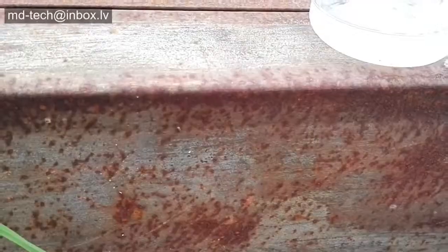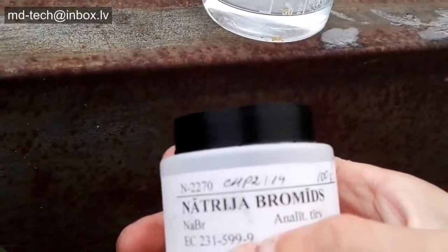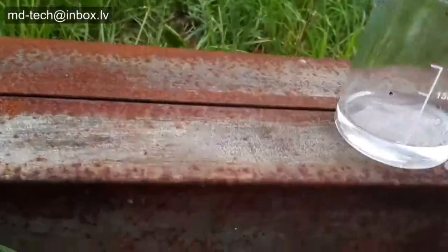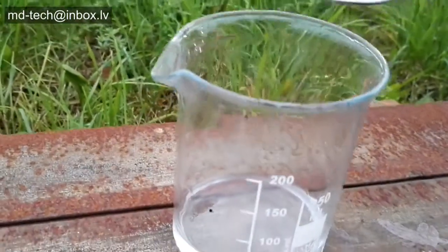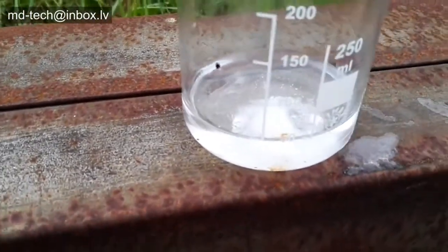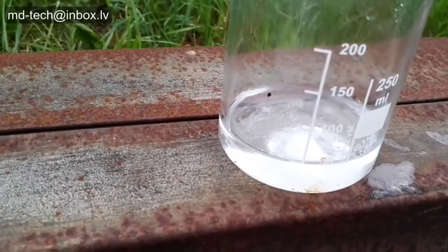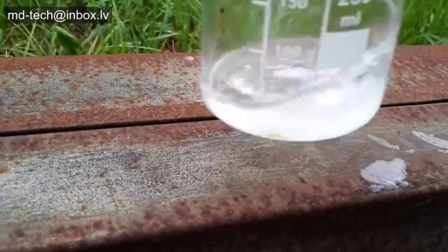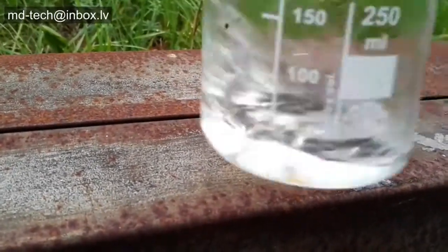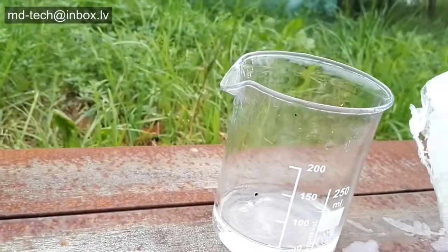I use sodium bromide dissolved in weak sulfuric acid solution. Then I add a small amount of sodium hypochlorite solution.